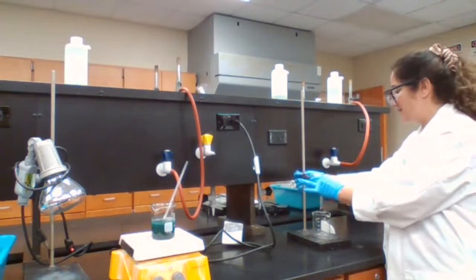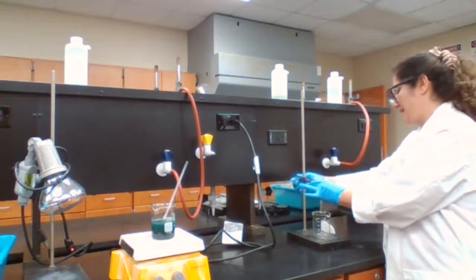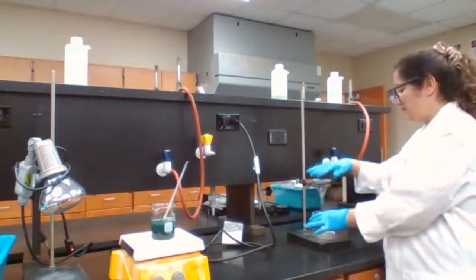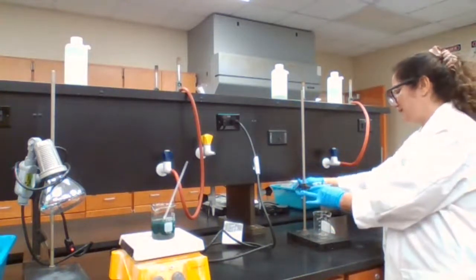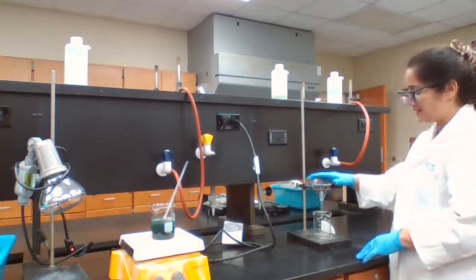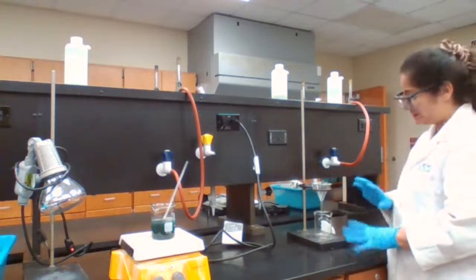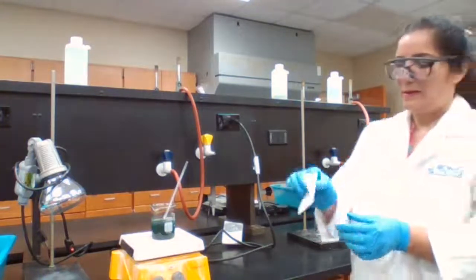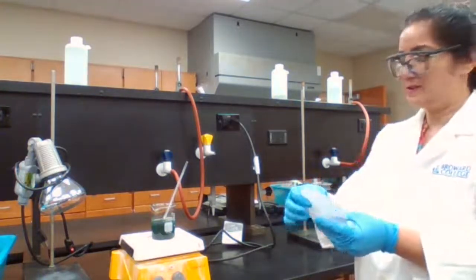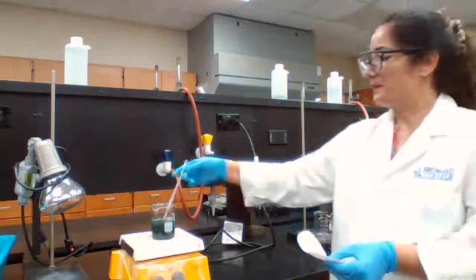But when it's inside, if it accidentally moves around, it's going to hit the container, hit the wall of the beaker, and as soon as it hits, it gives me a warning: be careful, you're splashing the solution out. So, filter paper is needed for gravity filtration.